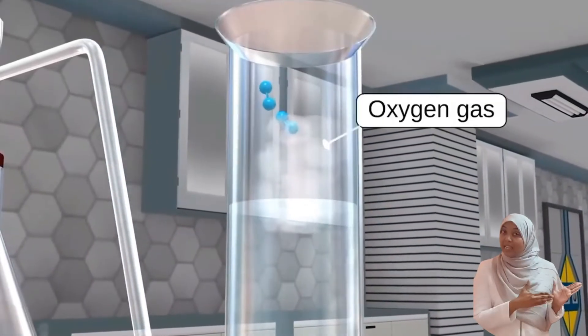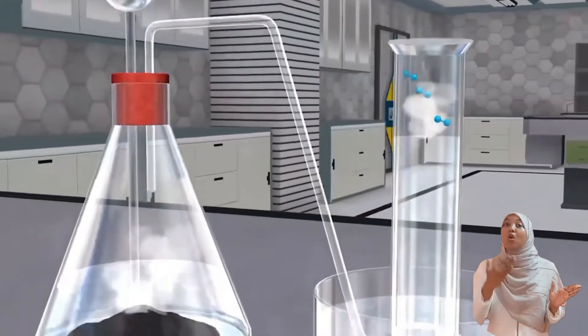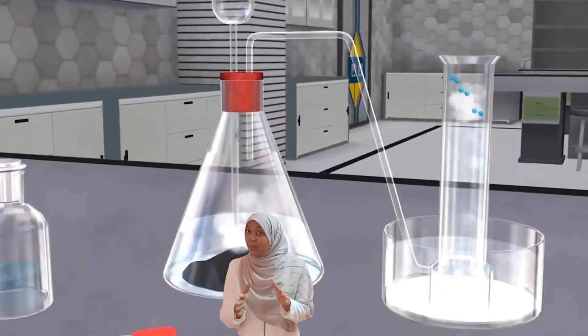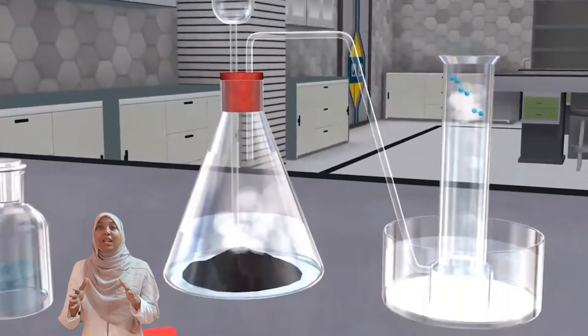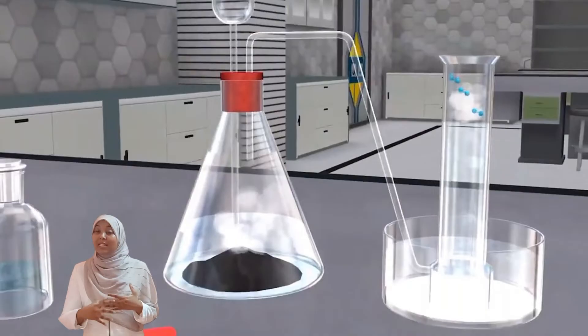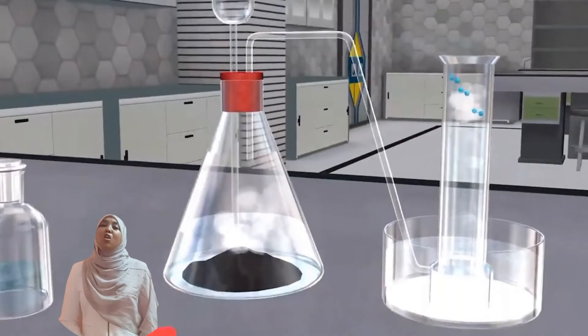Oxygen gas in this method is collected using the over water method. Over water method means you're collecting a gas over water. Gases collected using this method must be either insoluble in water or slightly soluble in water, such as oxygen.